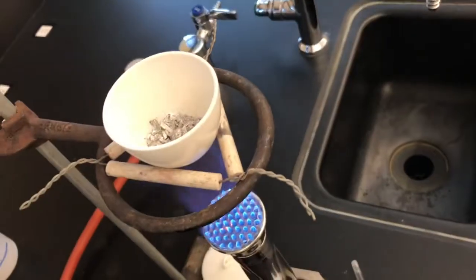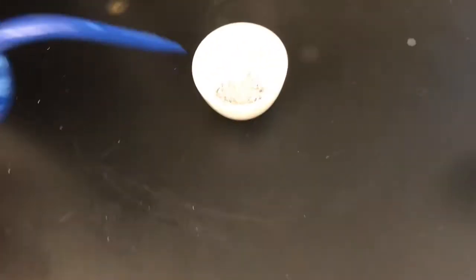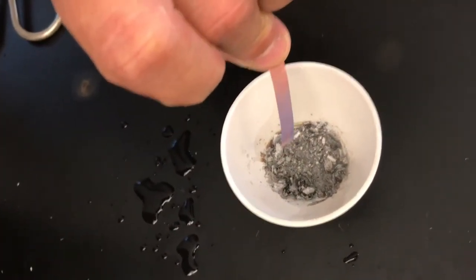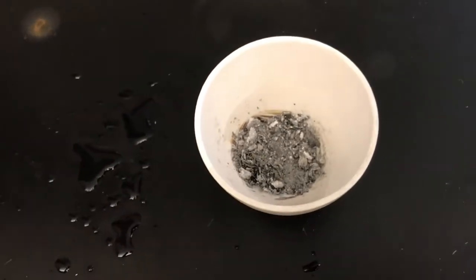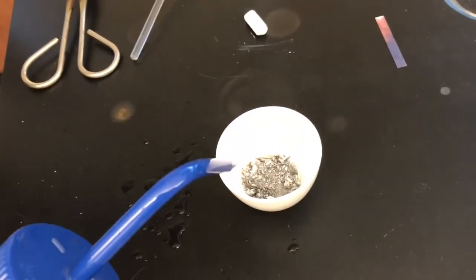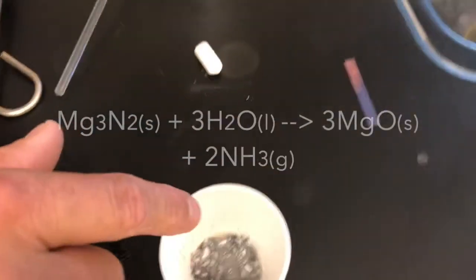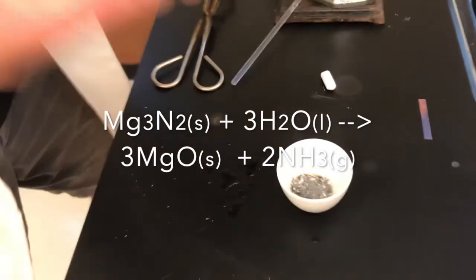Let me heat this up now just to guarantee complete reaction. I'm going to add a little bit of water — it's already cool. We wouldn't want to put the water in a hot crucible. What I'm going to do is show you with this red litmus paper that it's turning blue. That's a clue as to what's being produced — think about what's basic, what's a basic gas. I'm going to waft it. Hopefully you realize that ammonia is coming out of there. So we're getting rid of the nitrogen by allowing the ammonia to escape. Now all we have is wet magnesium oxide.